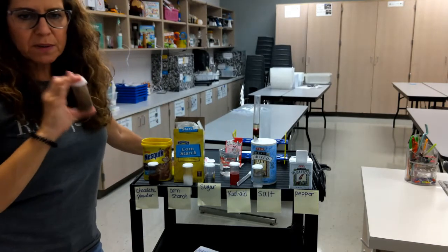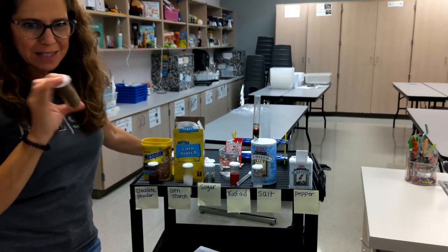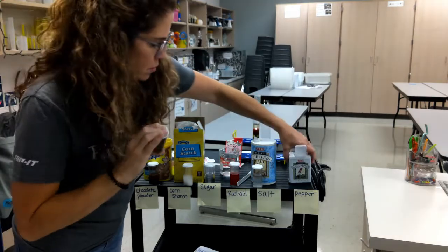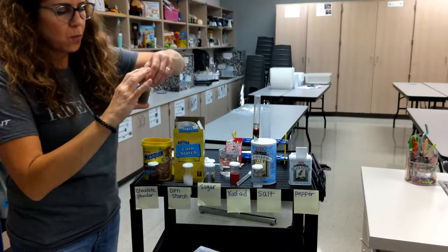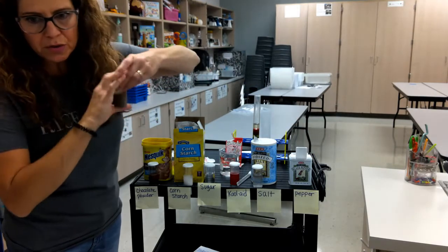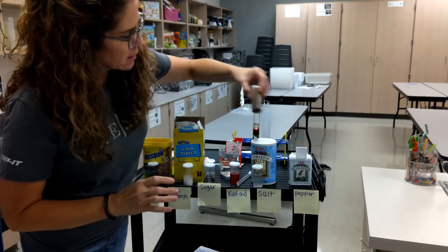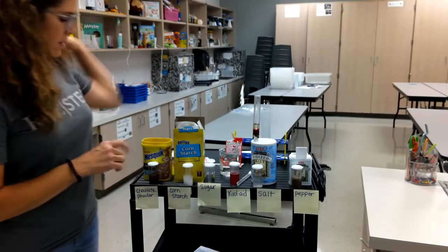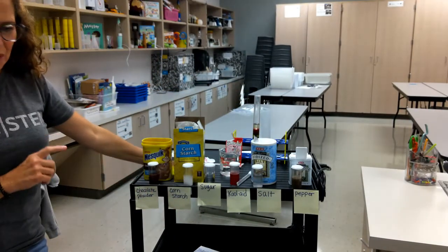If I wanted to be very scientific about this I would make sure that I timed how long I shook each one because remember we want to make sure that we control certain parts of our experiment, but we will talk about that more later. Okay, so now we're going to go back and we're going to see what each one looks like.